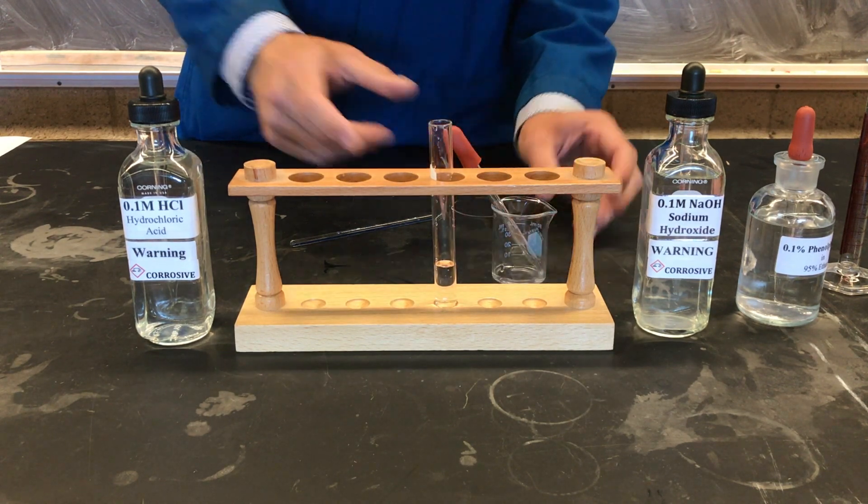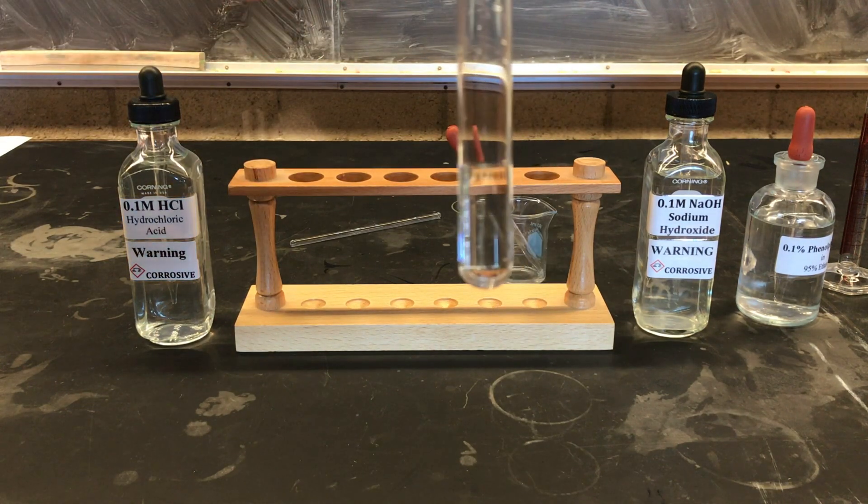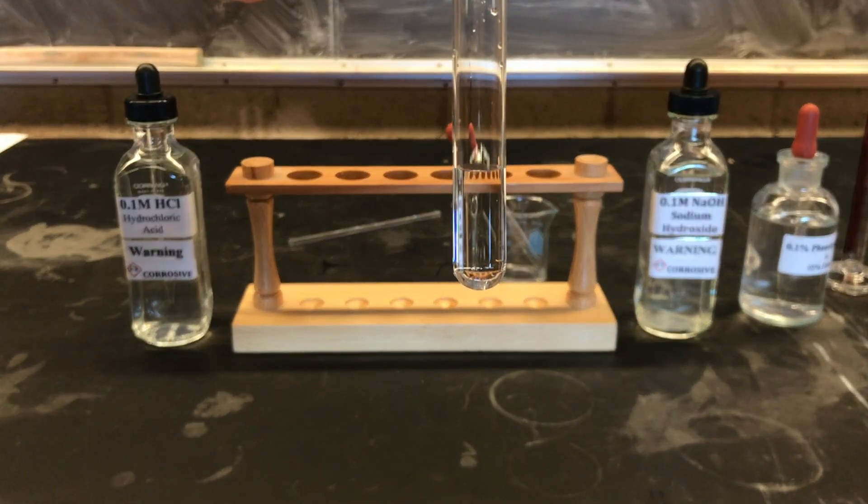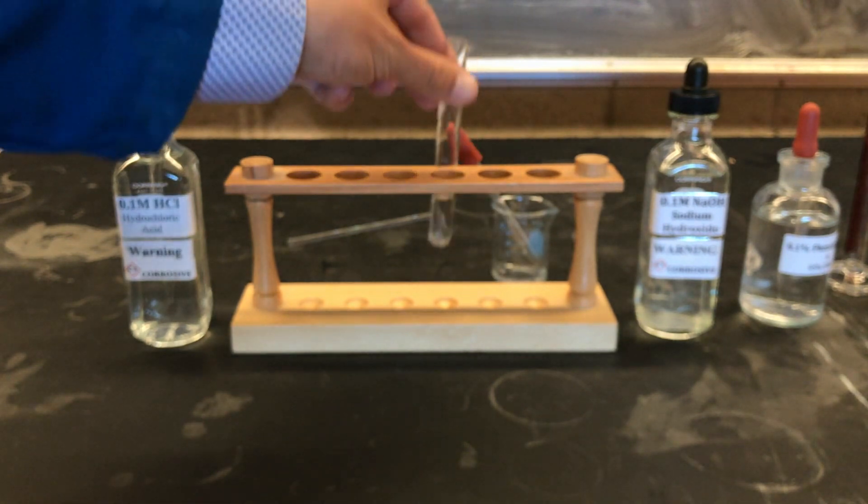After making our final observations, we'll dispose of our solution down the sink and clean our glassware. Best of luck completing the lab with your group. Ask your instructor if you have further questions.